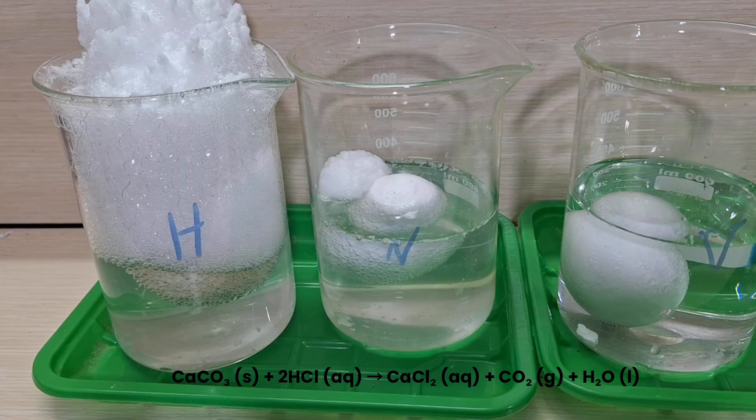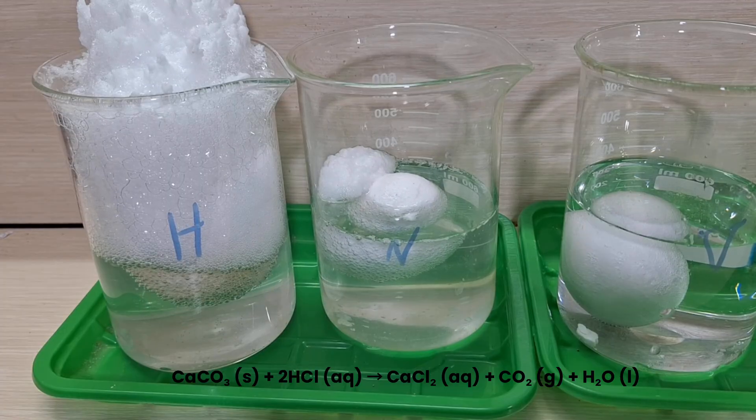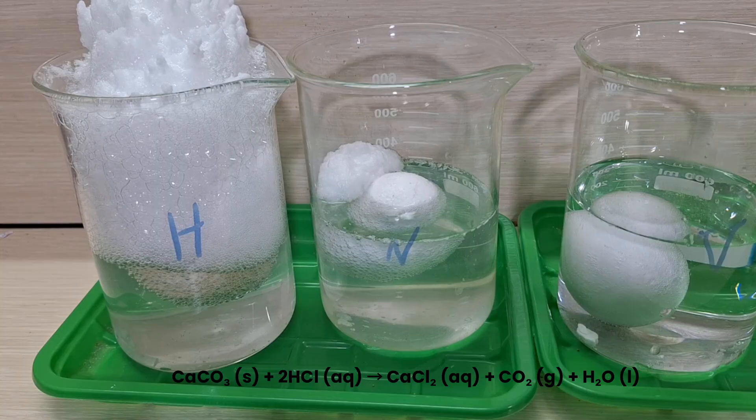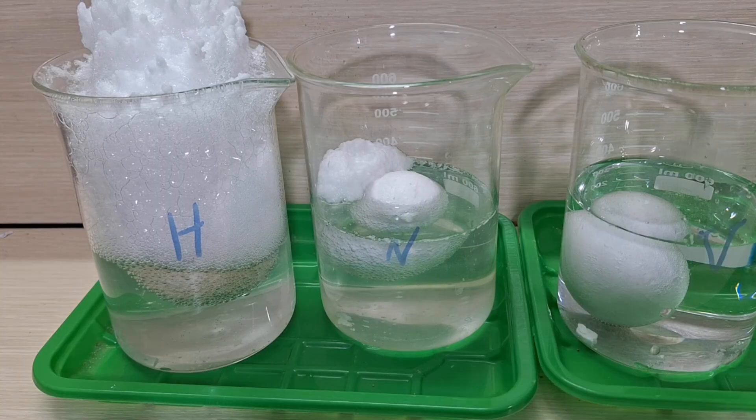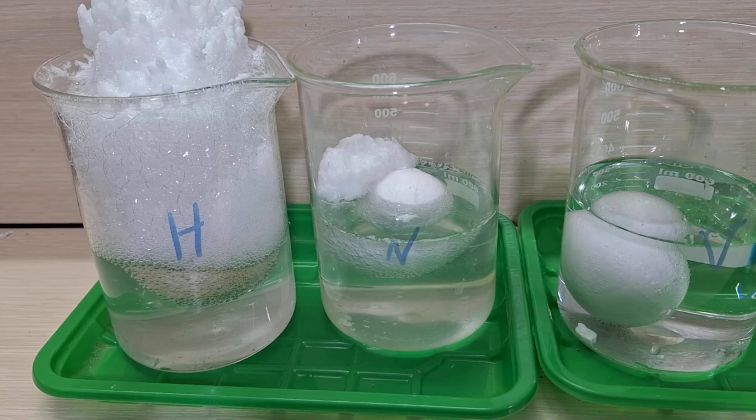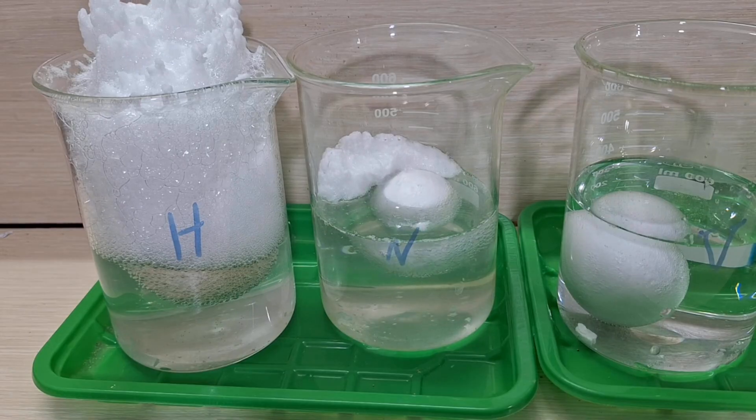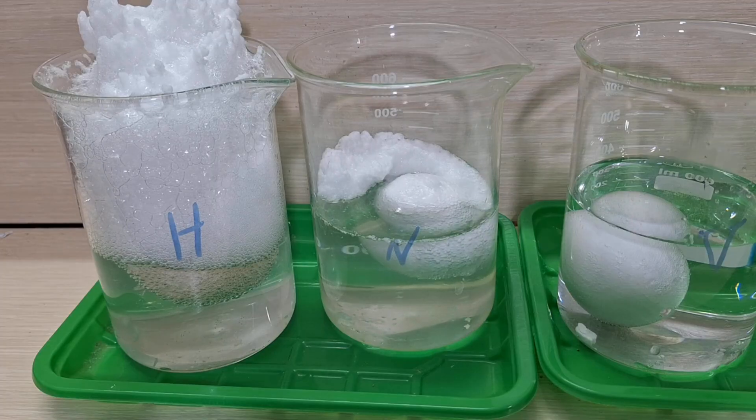Those white bubbles you see rising in the solution are carbon dioxide, CO2. You can see the chemical reaction below: CaCO3 + 2HCl → CaCl2 + CO2 + H2O.